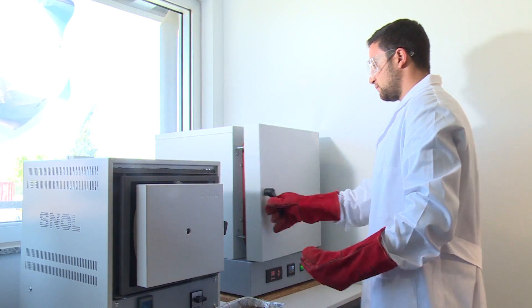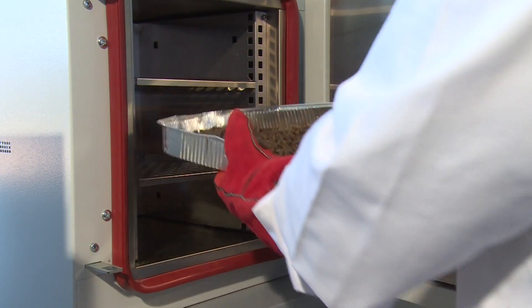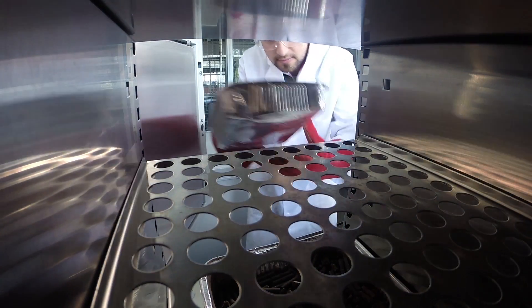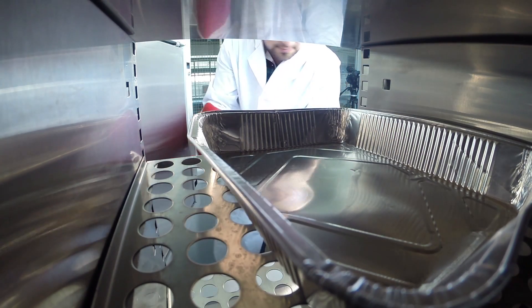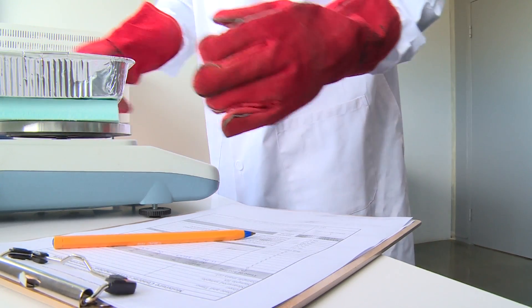Place the loaded tray together with the reference tray in the oven controlled at 105 degrees Celsius, and heat the trays until constant in mass. Solid biofuels are hygroscopic, and the loaded tray together with the reference tray shall be reweighed to the nearest 0.1 gram when still hot, within 10 to 15 seconds, to avoid absorption of moisture.